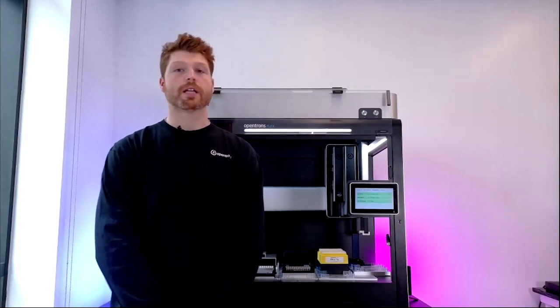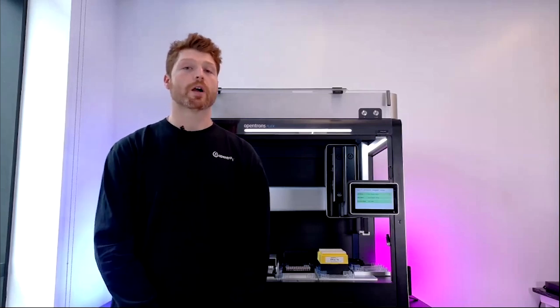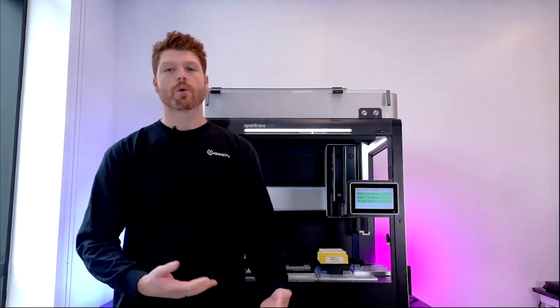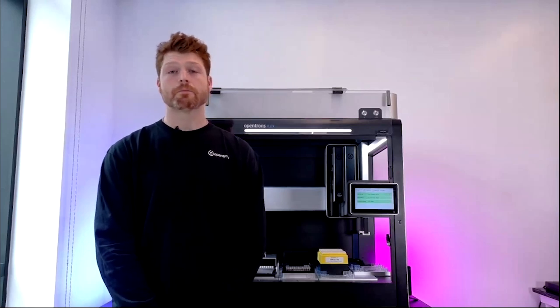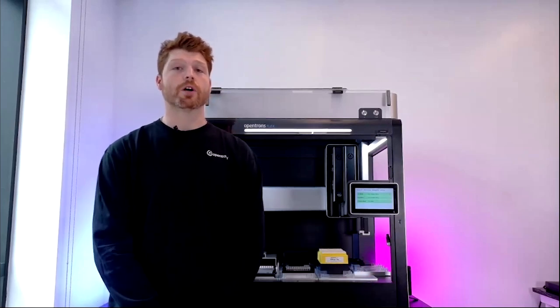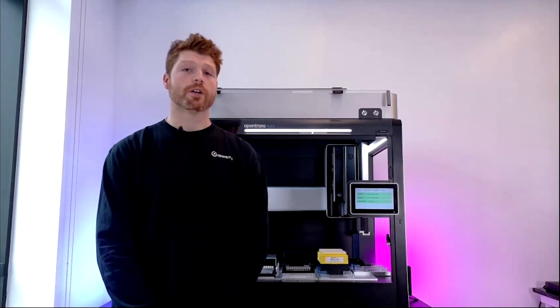And finally, the option that I'm going to talk about today is how to download a pre-existing protocol from our open access protocol library, which is a repository of pre-designed protocols that cover a wide range of applications, from DNA extractions to PCR setups. I'm going to walk you through the process of finding, downloading, and finally uploading a protocol which is going to fit your needs and hopefully fit your workflows.